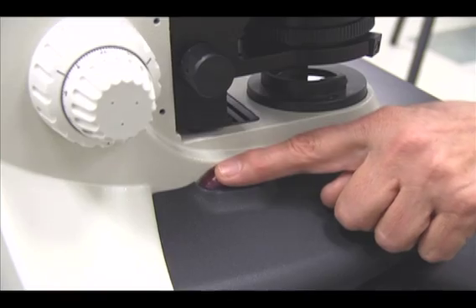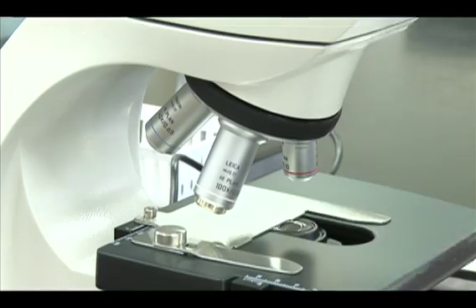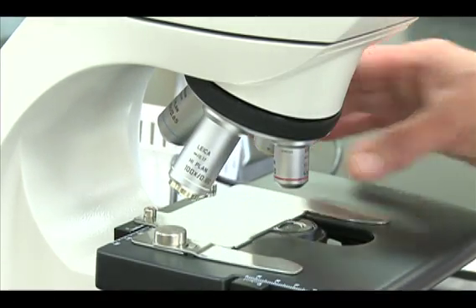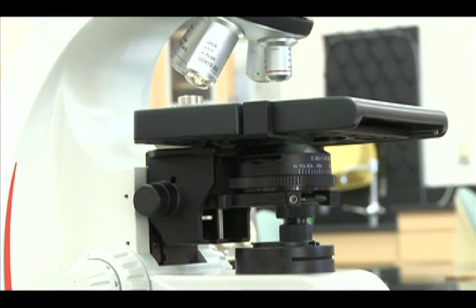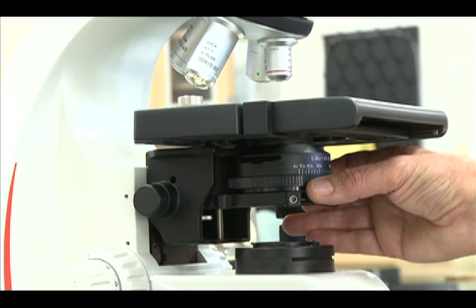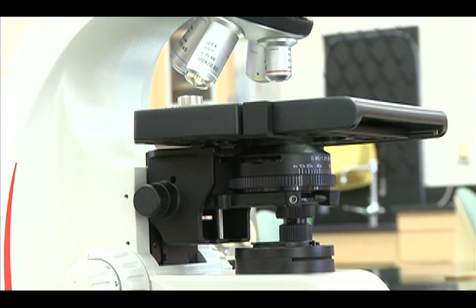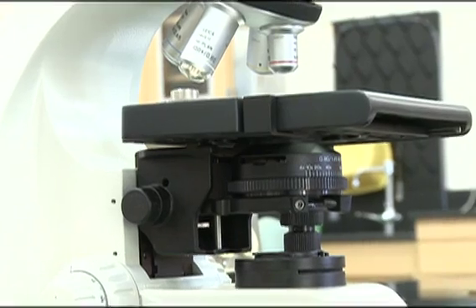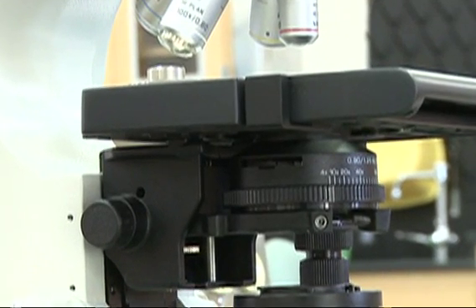Switch on the power. Assess the microscope. The 4x objective should be in position. The iris diaphragm setting should always be equal to the objective power, so it should also be set to 4x.